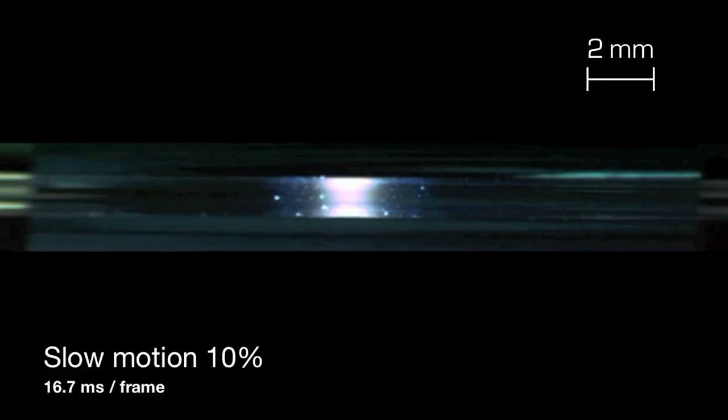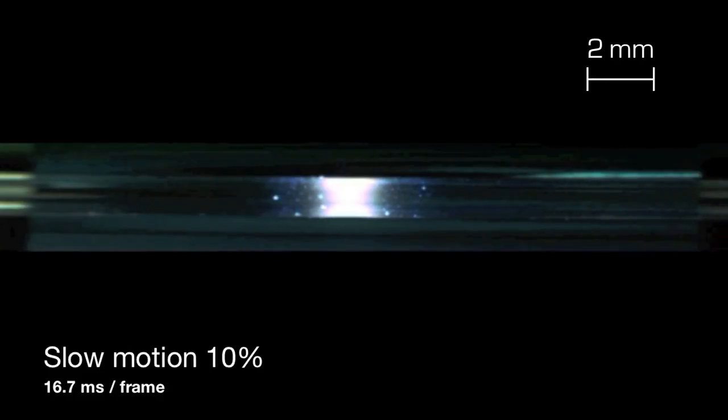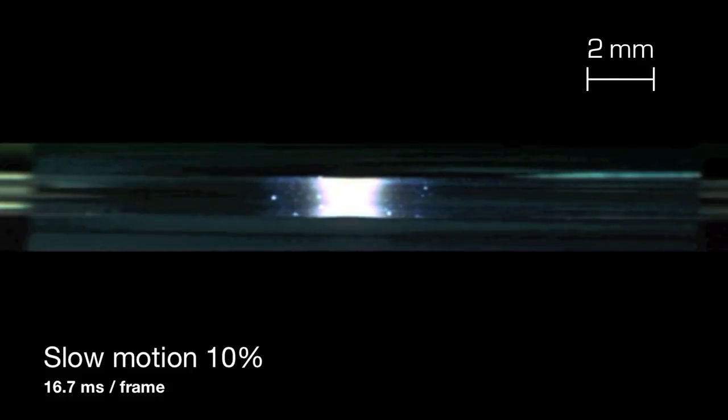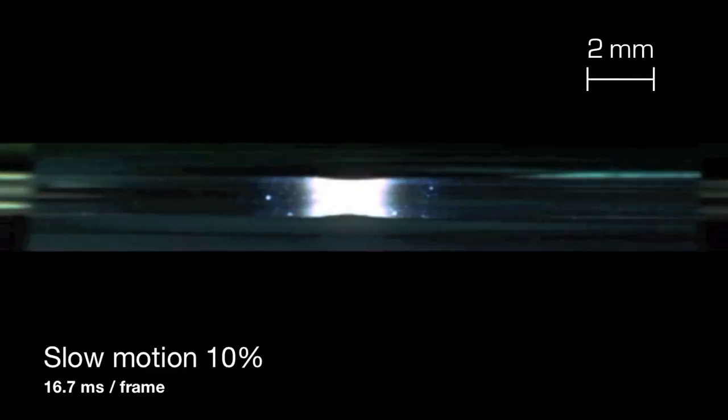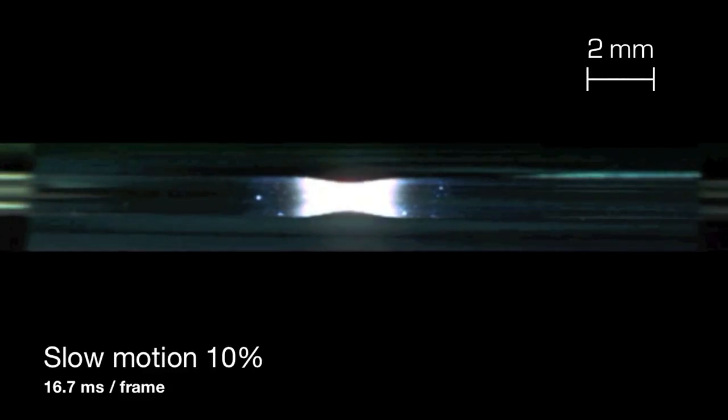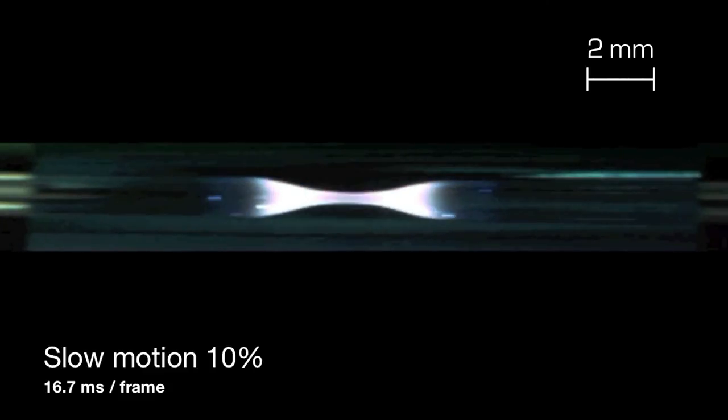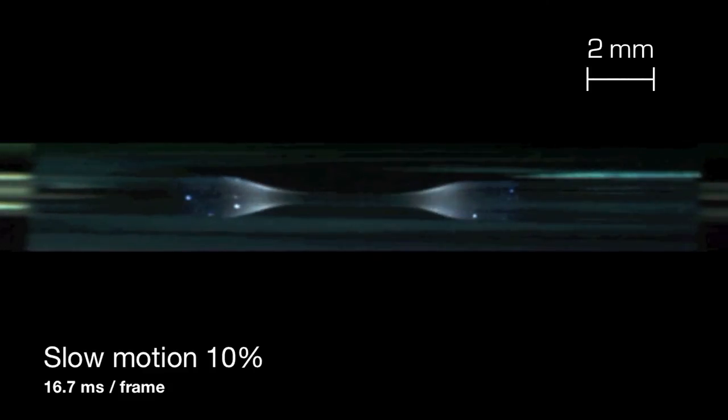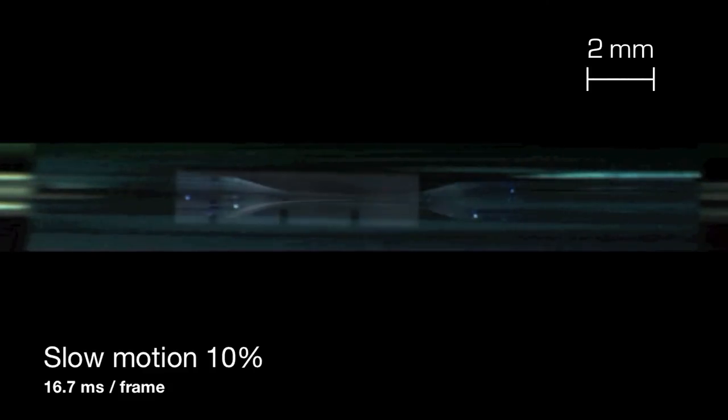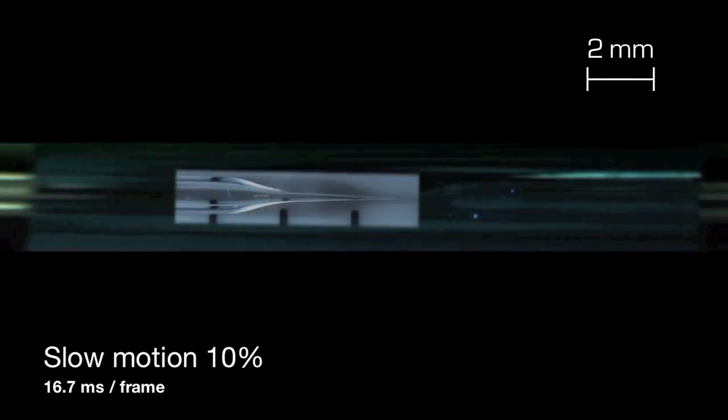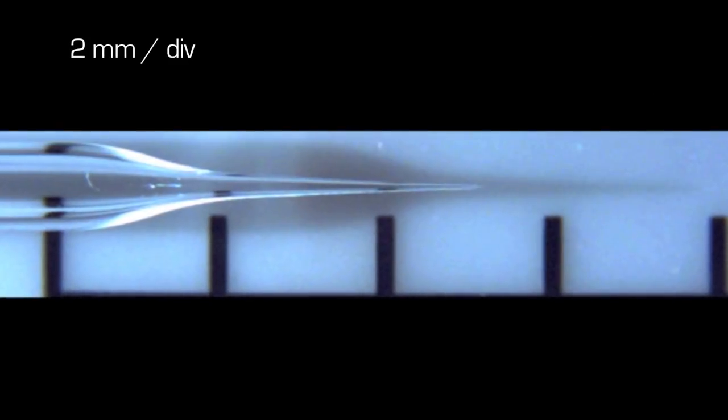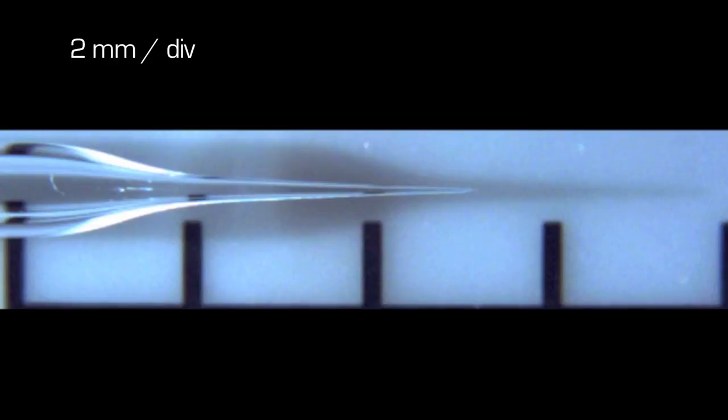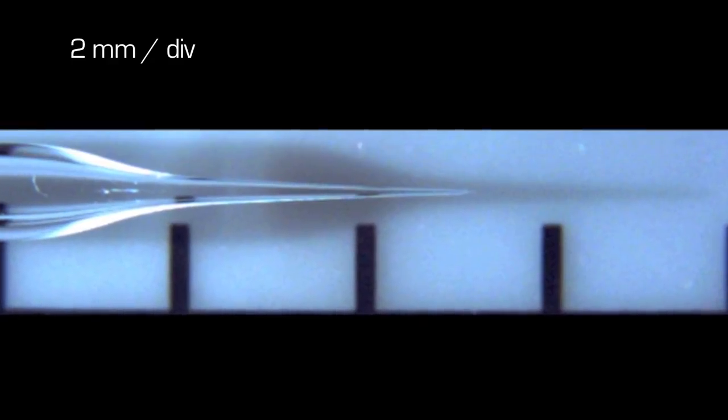Let's focus on the formation of the hourglass during the first pull and on how the hourglass relates to the tip of the final pipettes. Here is the original video again. After the hourglass has formed, an image of the final pipette is superimposed and aligned at the shoulders. Note how the pipette tip extends more than 1mm into the other side.